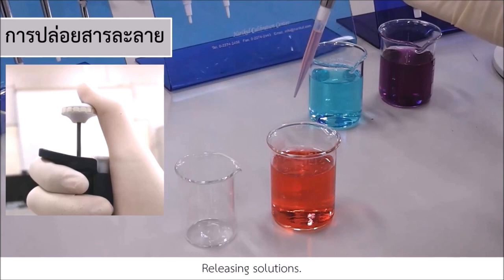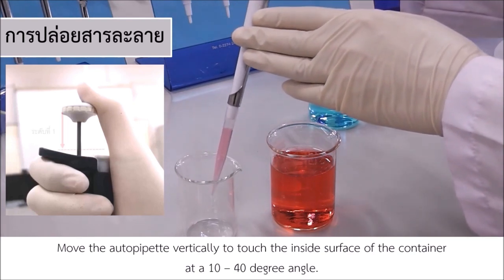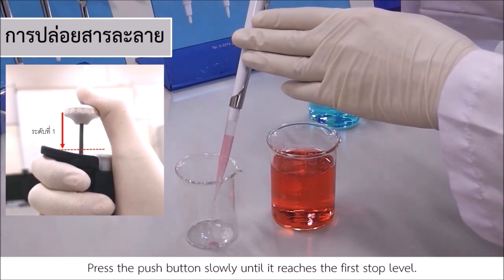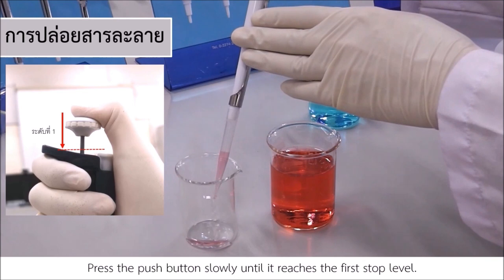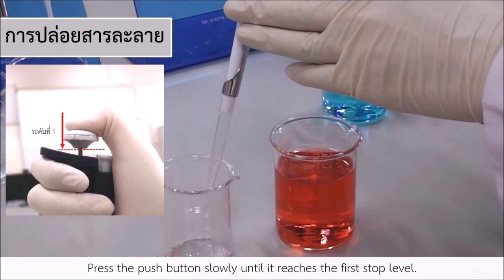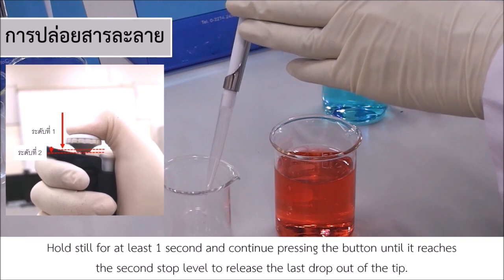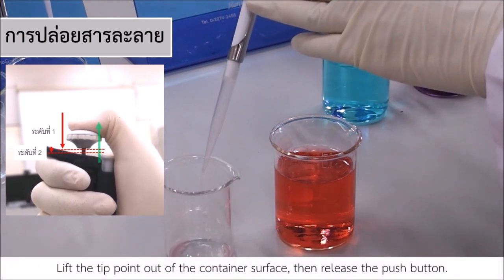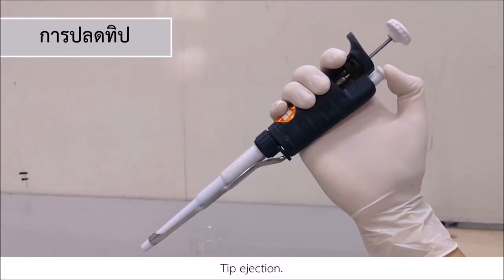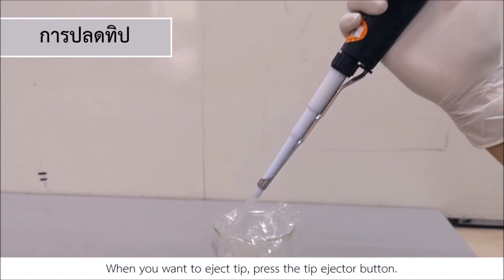Releasing solutions. Move the autopipette vertically to touch the inside surface of the container at a 10 to 40 degree angle. Press the push button slowly until it reaches the first stop level. Hold still for at least 1 second and continue pressing the button until it reaches the second stop level to release the last drop out of the tip. Lift the tip point out of the container surface, then release the push button. Tip ejection. When you want to eject tip, press the tip ejector button.